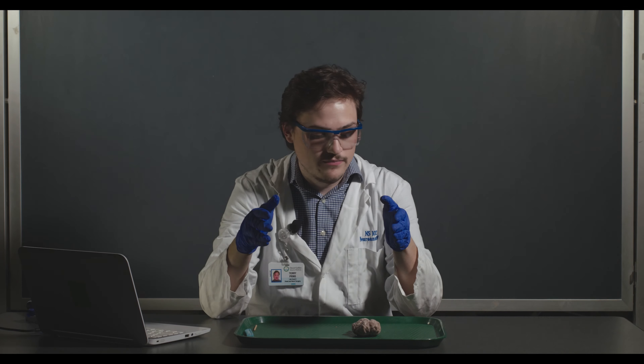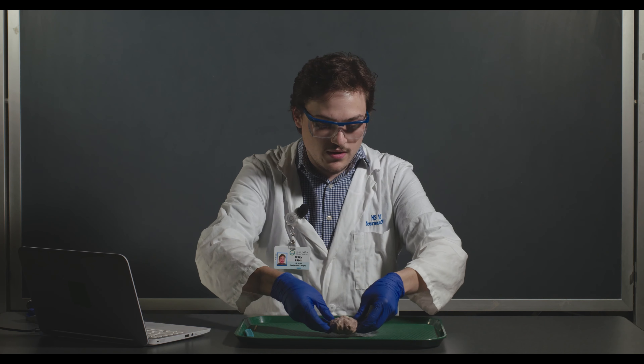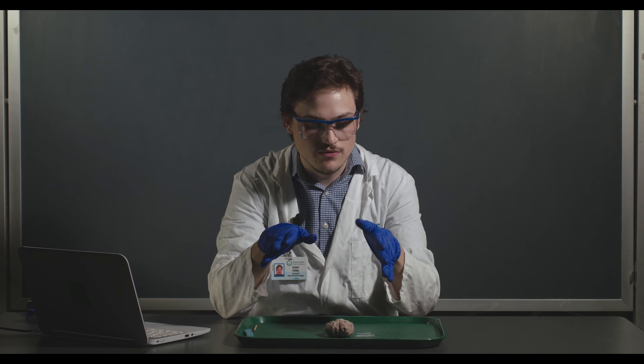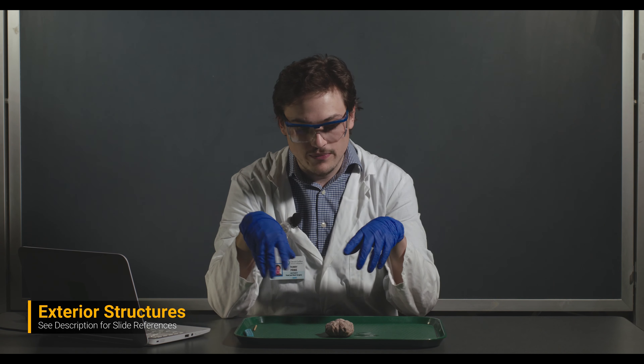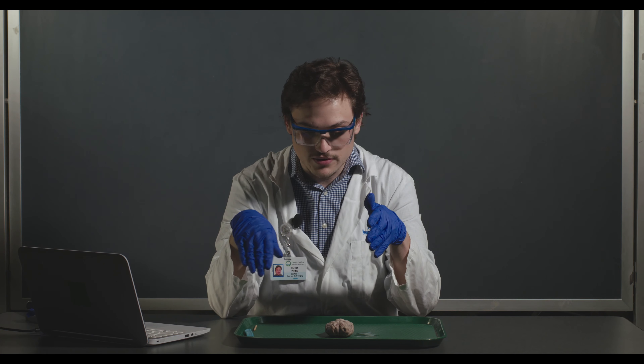Okay, with that we're going to transition to the sheep brain dissection itself. We have our sheep brain here, and before we make any cuts, I want to talk about some of the structures you can see on the exterior, as well as some things visible on the ventral and dorsal surfaces.